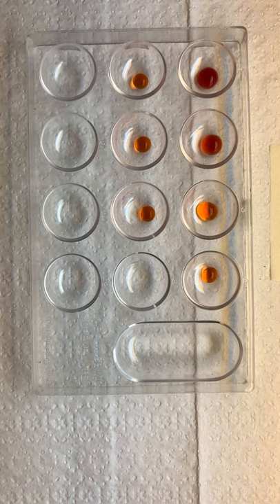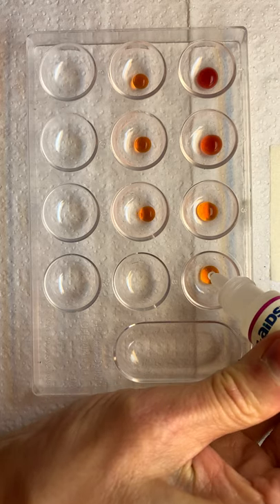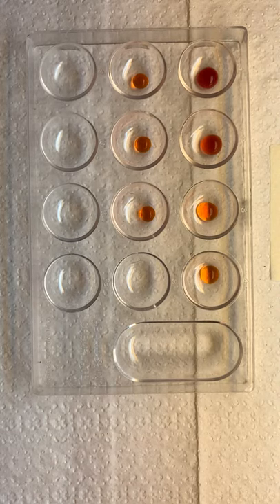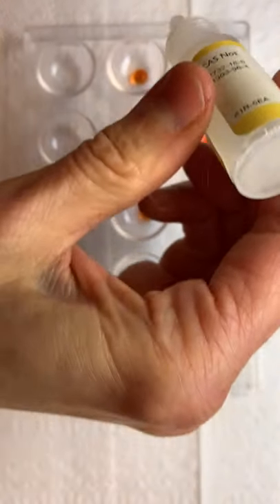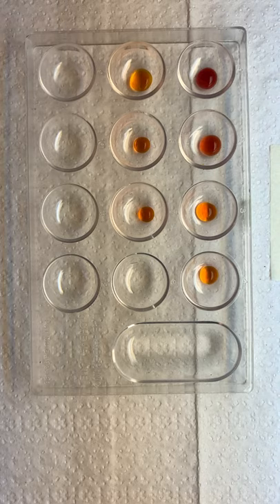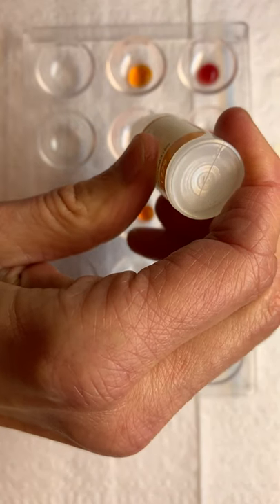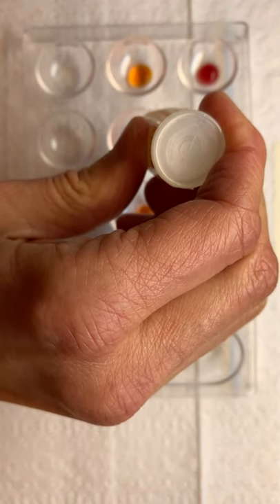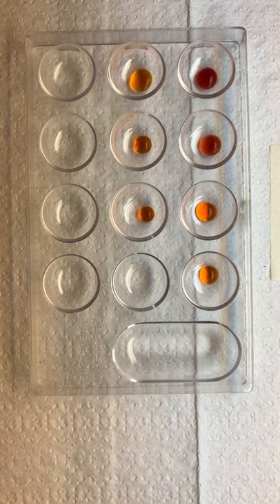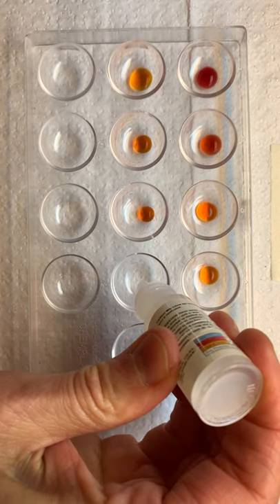We've got pH seven — one drop. Then pH nine. And our last one is pH 13, the most basic that we have.